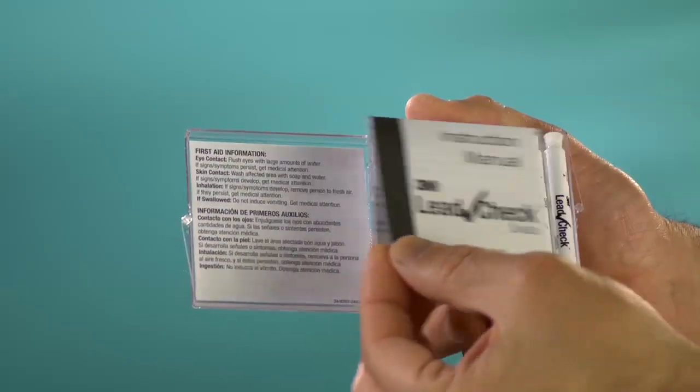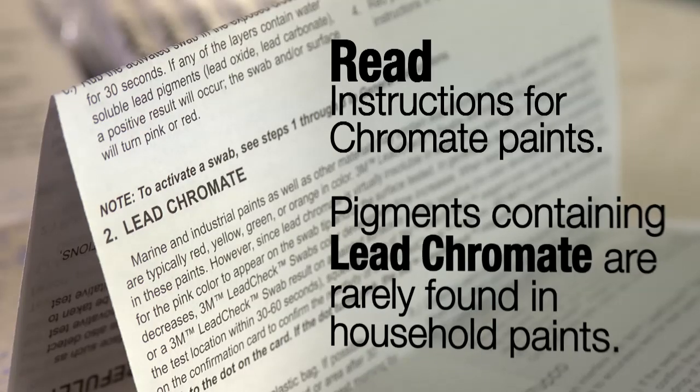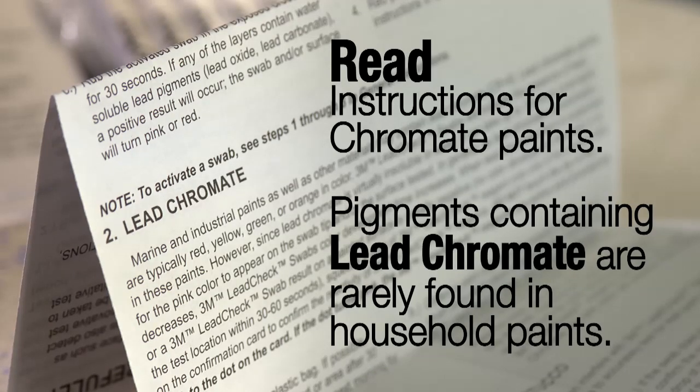Testing some industrial paints requires longer development time. Read the instructions regarding chromate paint in your instruction sheet for more information. Pigments containing lead chromate are rarely found in household paints.